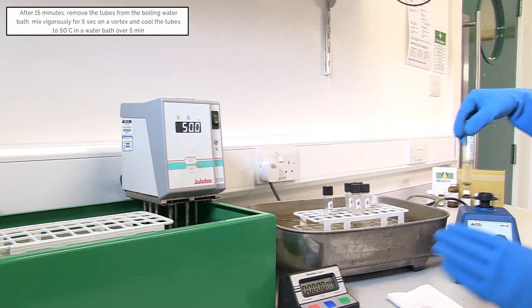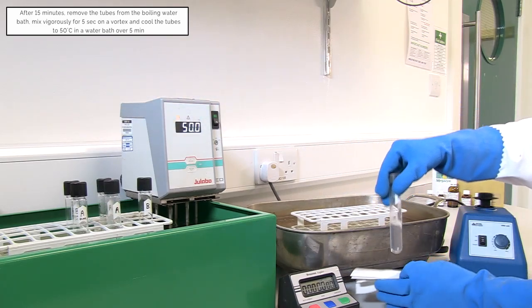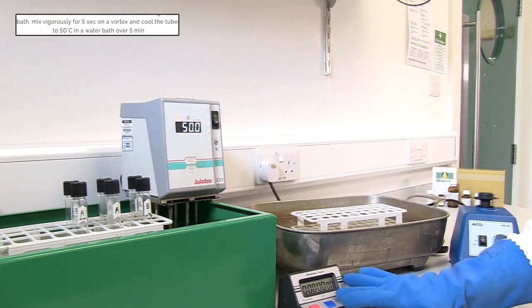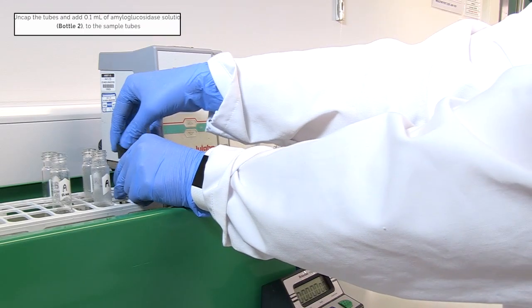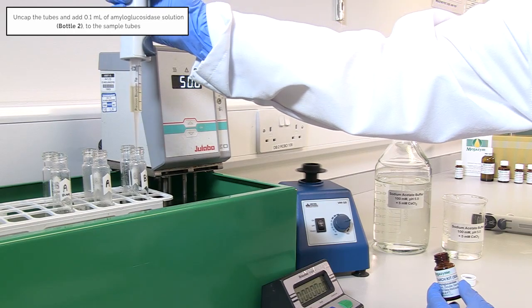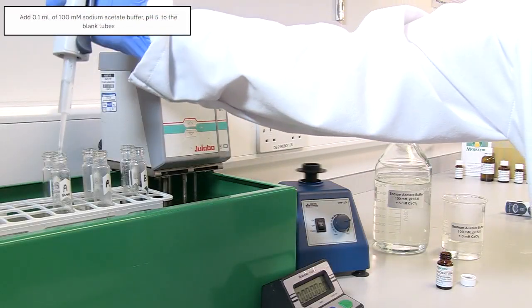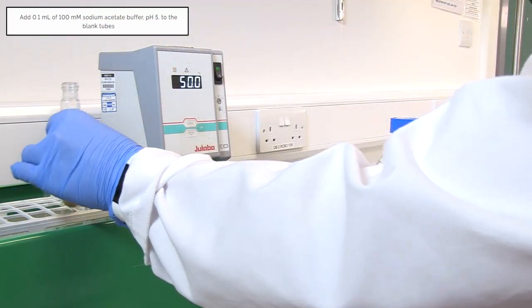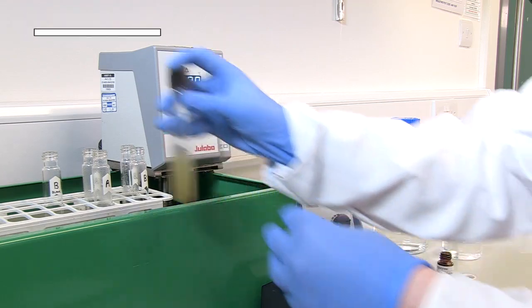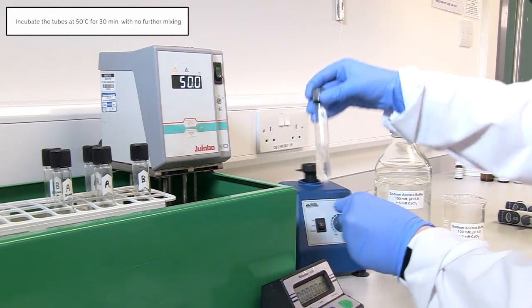After 15 minutes, remove the tubes from the boiling water bath. Mix vigorously for 5 seconds on a vortex and cool the tubes to 50 degrees Celsius in a water bath over 5 minutes. Uncap the tubes and add 0.1 millilitres of amyloglucosidase solution to the sample tubes. Add 0.1 millilitres of 100 millimolar sodium acetate buffer to the blank tubes. Vortex the tubes for 3 seconds and incubate the tubes at 50 degrees Celsius for 30 minutes with no further mixing.